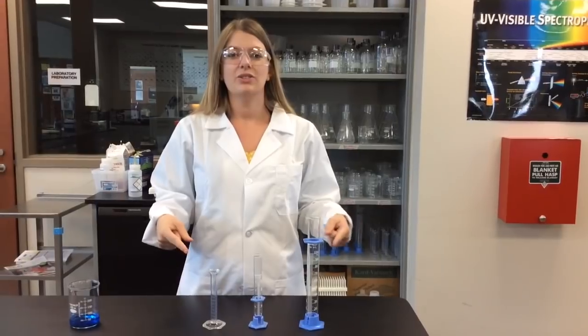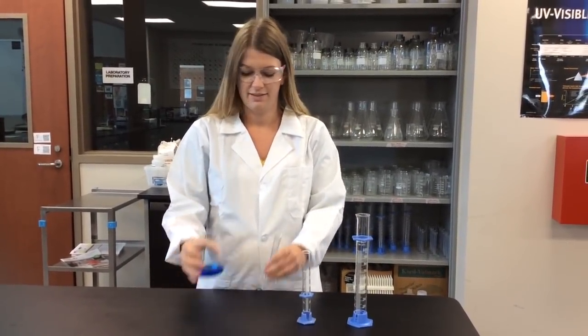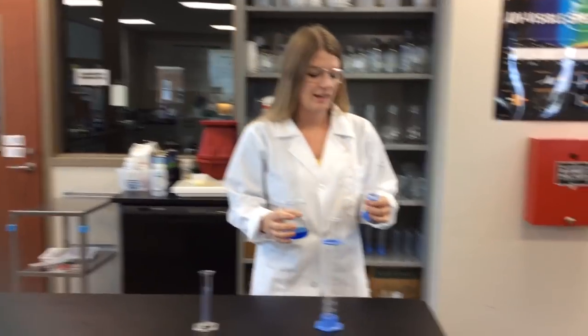These are used to measure liquids. So what we can do, carefully, we'll use this one because this one has a cool measuring thing.